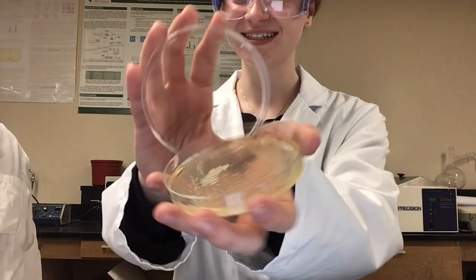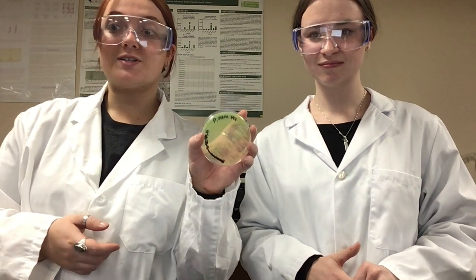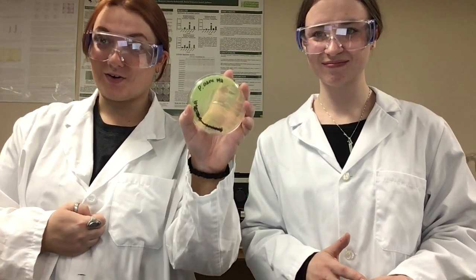Staphylococcus aureus is a gram-positive cocci that is commonly isolated from infections within biofilm formations. Staphylococcus aureus can provide us with yellow or white colonies. Lastly on our list, we have Pseudomonas aeruginosa. This is a gram-negative rod that's a facultative anaerobe, and it's a common pathogen in plants, animals, and people alike. When we inoculate Pseudomonas aeruginosa on the Mueller-Hinton agar, it turns this crazy green color.